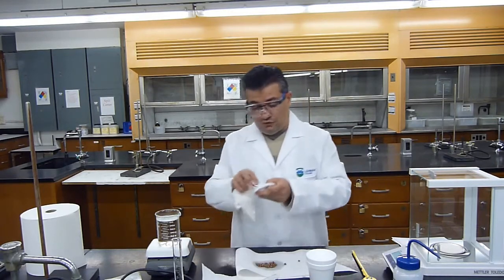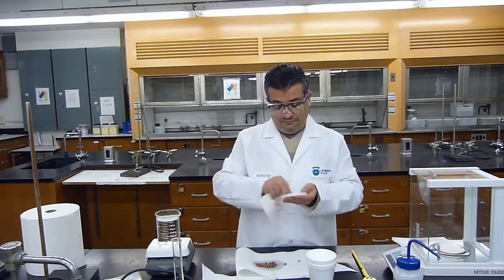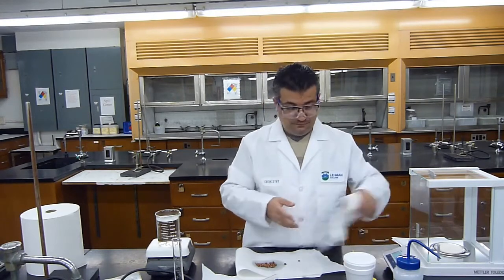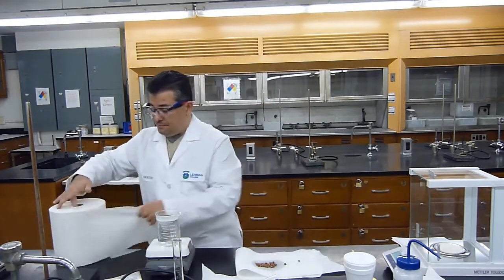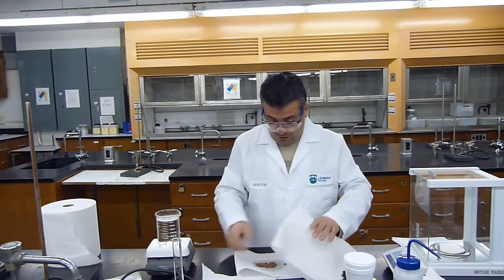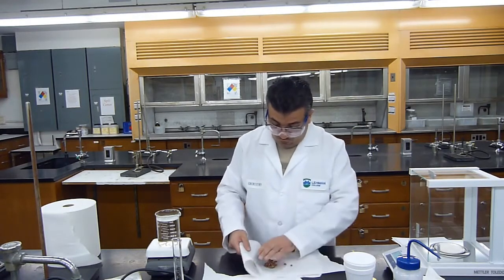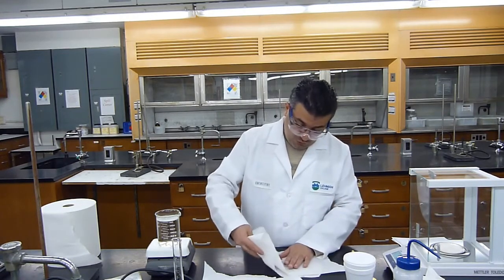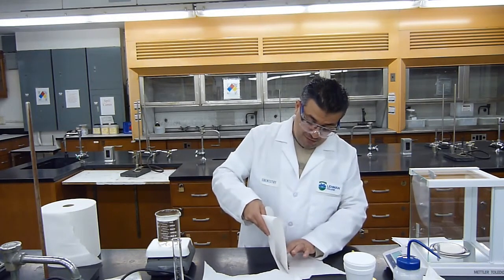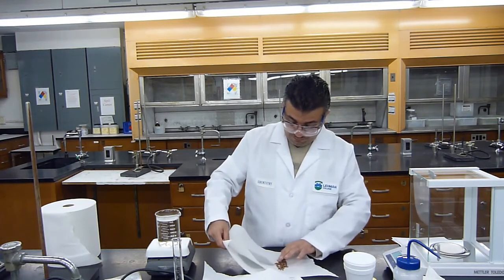I will also dry the cover. Okay, wipe the outside. Okay, I will get another piece of paper towel, to make sure that I dry all of the metal. Be careful, don't lose any. Like I said, if we lose any of it, we have to reweigh it. I'm going to move the metal onto a dry spot on the towel.